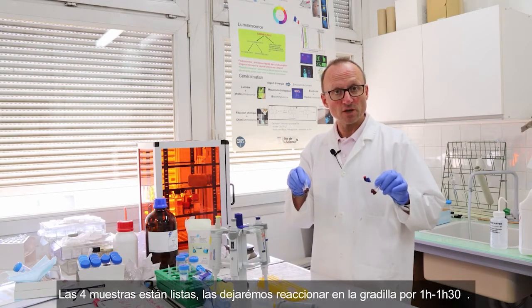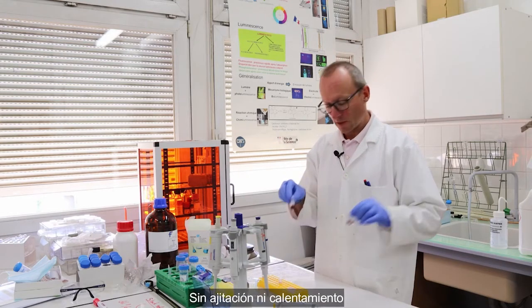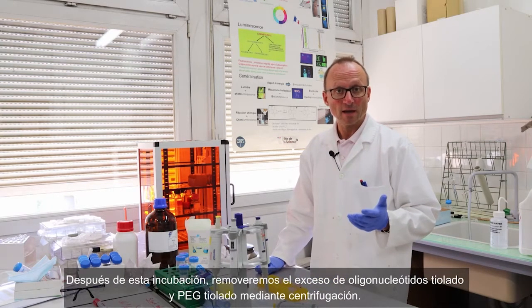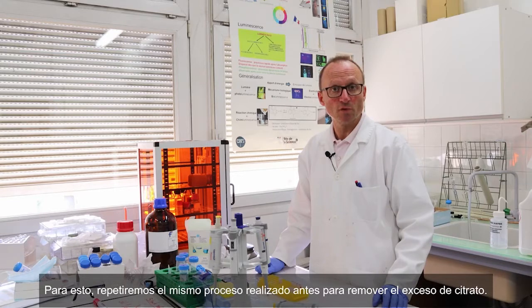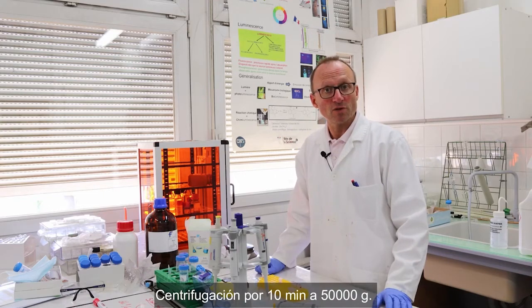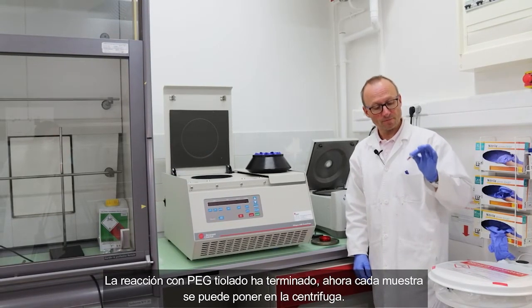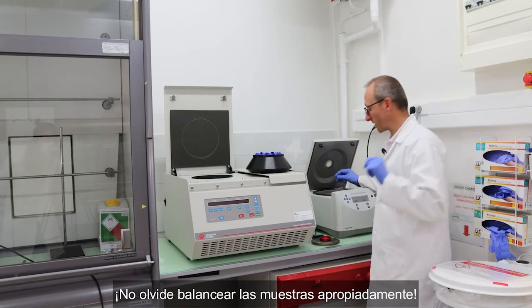We will leave them on the bench for 1 hour up to 1 hour 30 without any stirring at room temperature. After this incubation, we will remove the excess of thiolated oligonucleotide and thiolated PEG by centrifugation, the same way as we did before to remove the excess of citrates, using a centrifugation step for 10 minutes at 15,000 Gs. So the reaction with the PEG thiol is done now. Each sample can be moved into the centrifuge. Don't forget to properly balance all your samples.